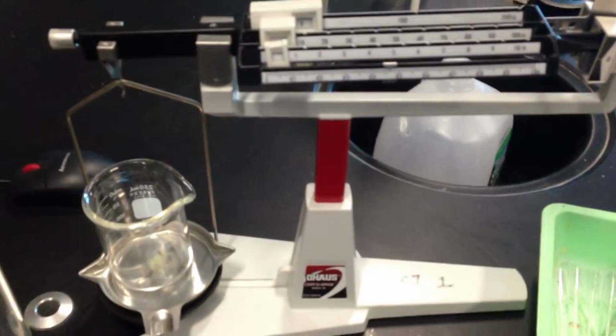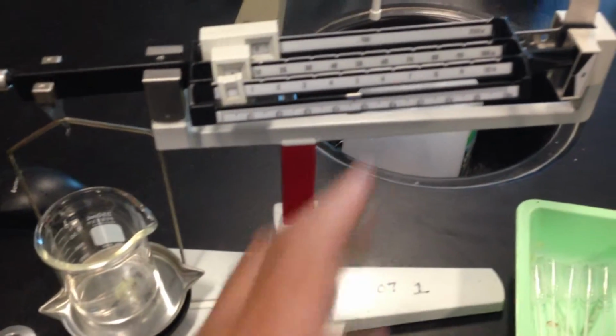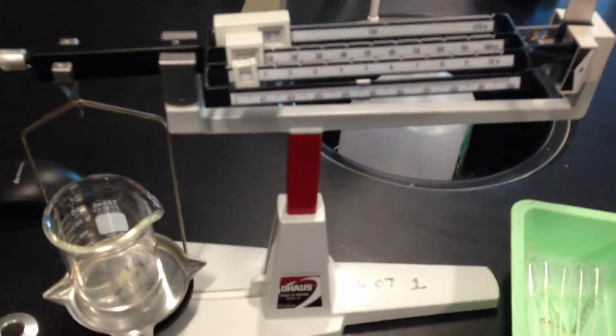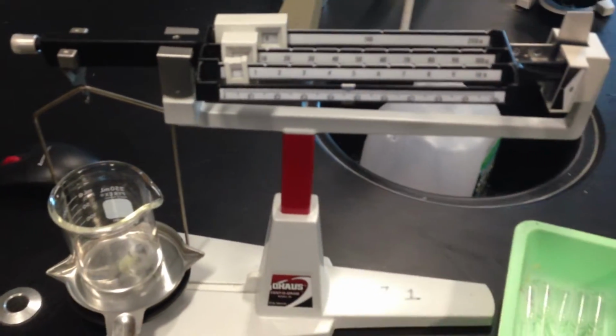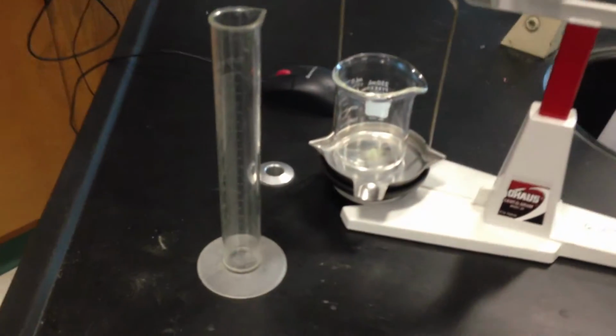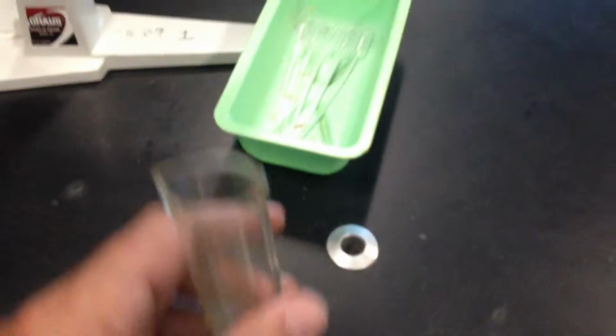And of course, once you have the mass of the beaker, pour in the liquid, okay, and of course find the new amount of grams from the triple beam balance, and what you're going to get there, the difference of those two masses is the mass of your liquid. Mass divided by the volume, which is 100.0 in this lab, gives us our density, and we're going to do that for the 3 liquids. Okay, no problems there.